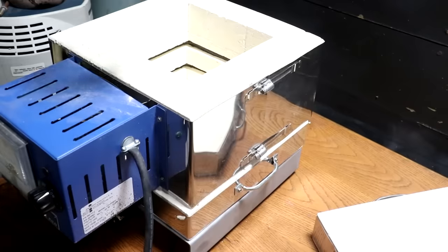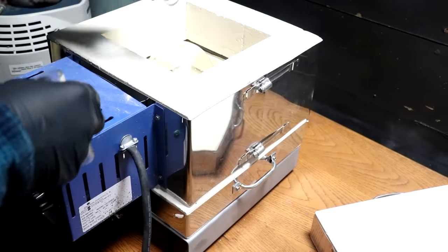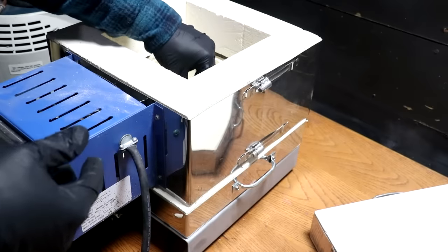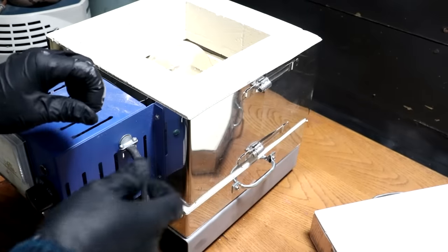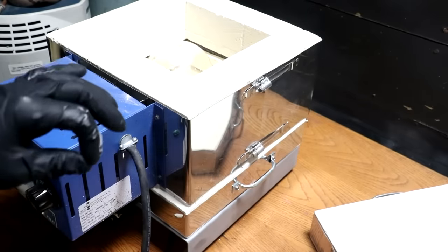So the idea here is I'm going to put it inside of this furnace, turn the furnace on, and bring it up to about not hot enough to melt the glass. I don't even want the glass soft, just hot so that the torch won't be as much of a thermal shock. So we're probably around 800 degrees, just barely glowing red hot should do it.